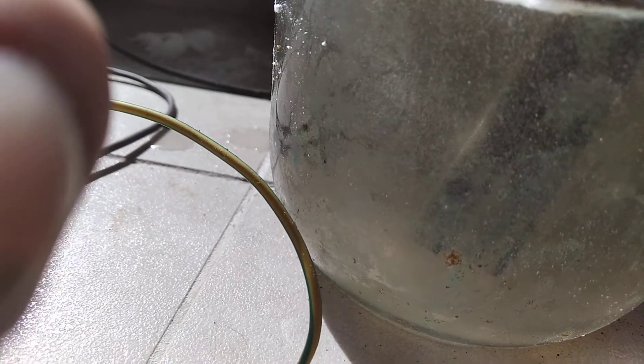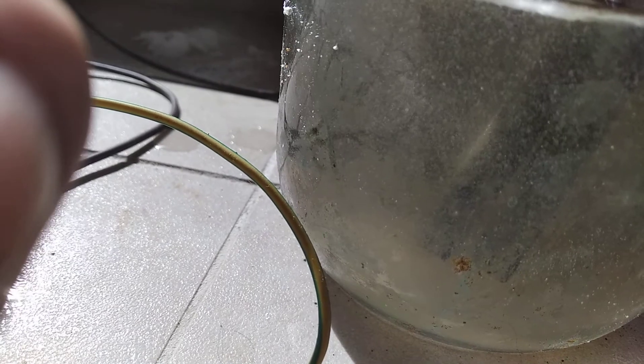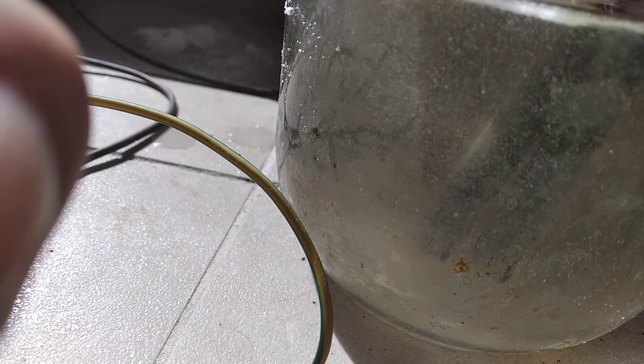After a few days this should be nearly pure chlorate because the moment it does start degrading even if calcium chloride is added, it means that the chloride levels have gone down and now the chlorate is the one that's being electrolyzed.